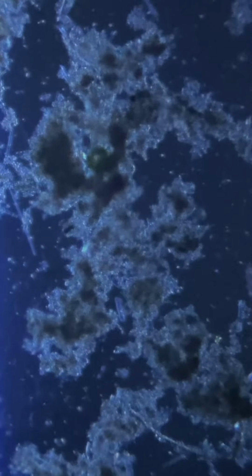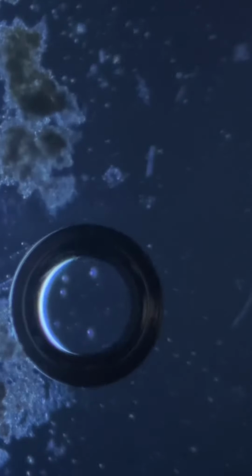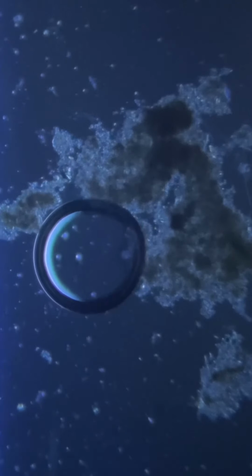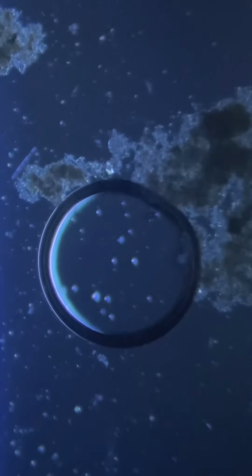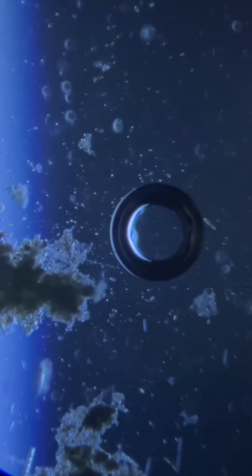Now back at 100 magnification, as I added the hydrogen peroxide, you can see the wave clearly wash over the slide. Right away we see bubbles form as the hydrogen peroxide comes in contact with an enzyme called catalase, which is an enzyme found in most organisms. It is known to catalyze H2O2 into water and oxygen. So what you are seeing is oxygen bubbles being formed.